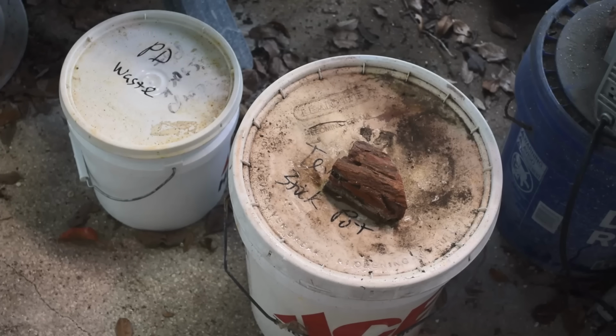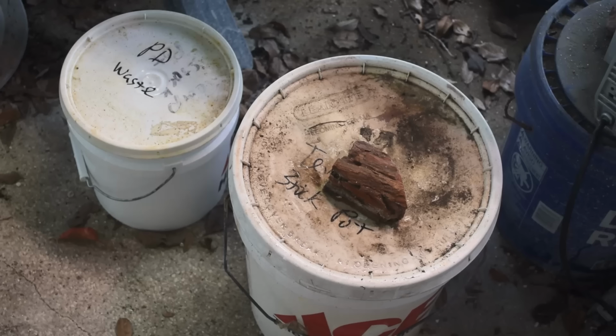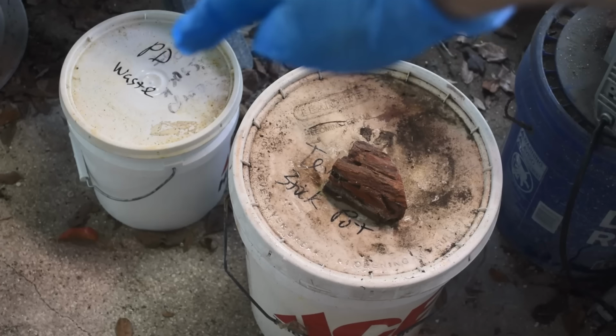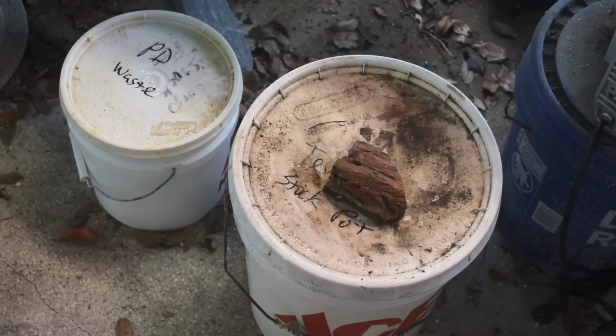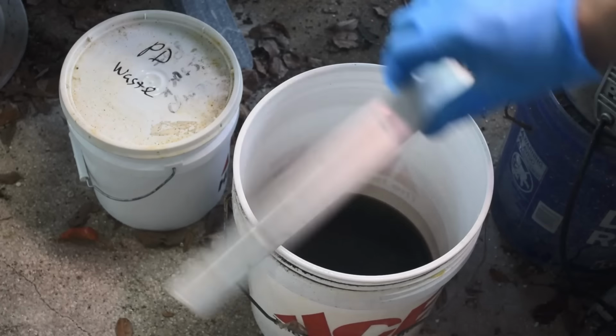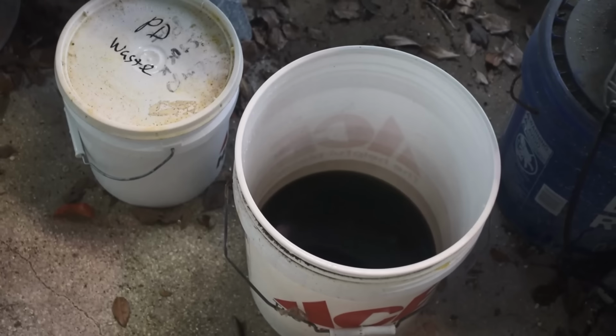All right, so those of you who watched the last episode in this series, episode 6, I'll put a link in the upper right. Remember that I have about 2 gallons of waste liquid over here from processing the palladium. And I need to do something with it. Here's my temporary stock pot. So I have just dumped off a lot of the liquid in here into the main stock pot to make room in it. So I can put the palladium waste in here.